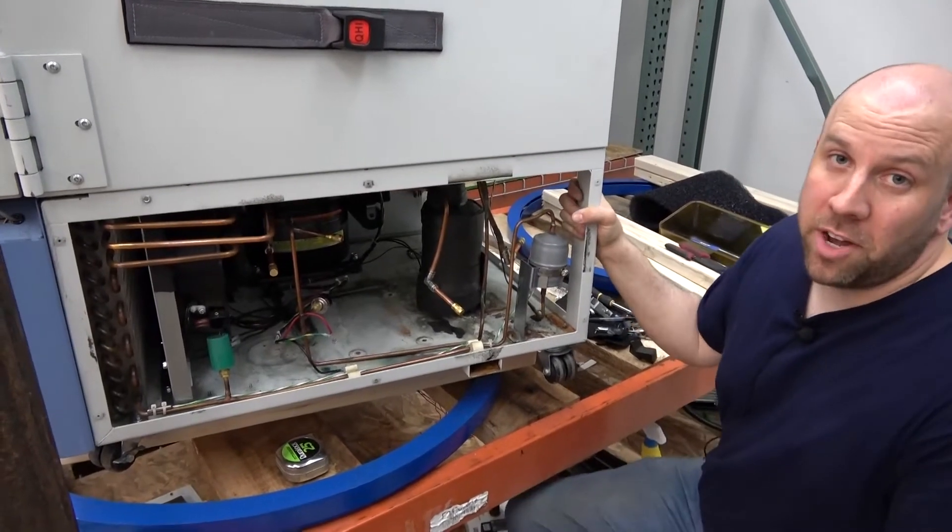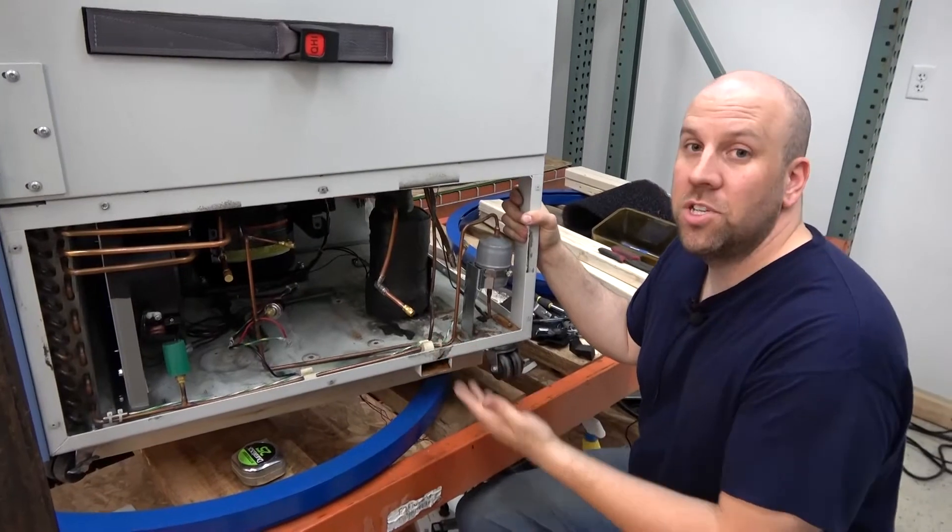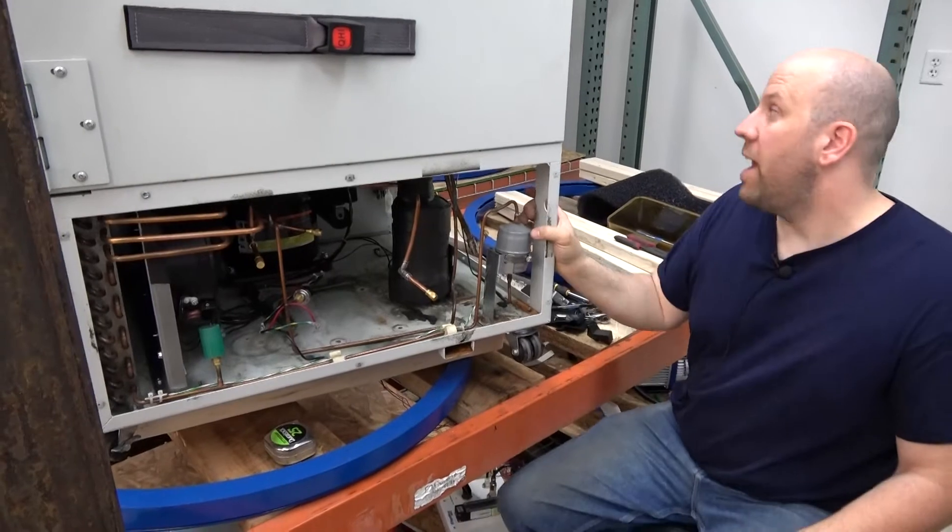We try to get everything out of the system, any particles that were in there, any kind of buildup in the lines. Flush it real good. And then once we're done flushing with alcohol, we hook up a nitrogen generator and run nitrogen through these lines once again for hours to make sure we're evaporating every little last bit of alcohol. That's why we had to get a nitrogen generator—using bottles of nitrogen to purge these lines for hours would be a lot of bottles.